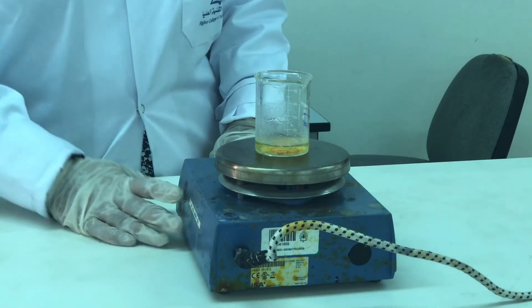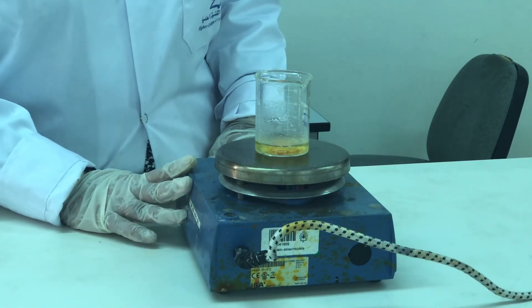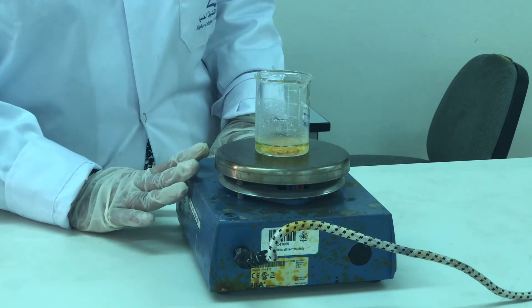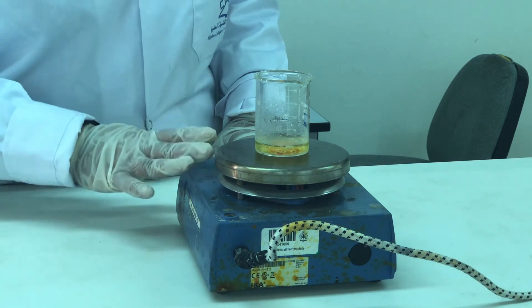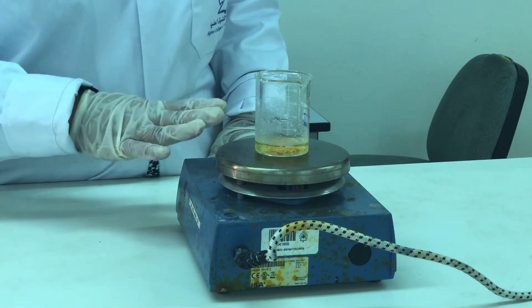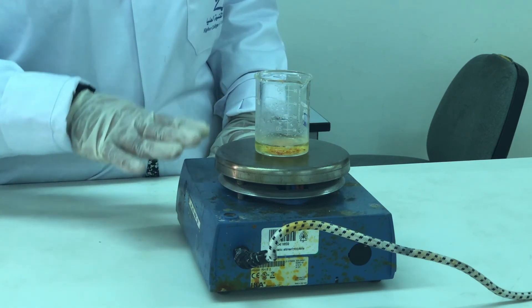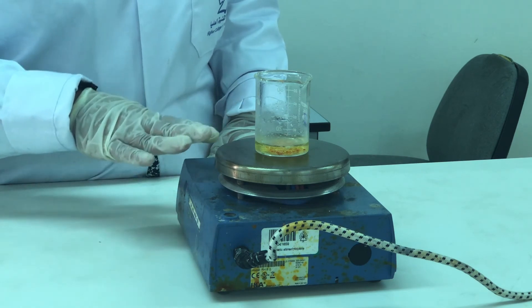Okay, this is the last step. After filtration, you get the crude product. You know what we mean by crude product? It has got a lot of impurities like excess of bromine water plus our compound and the other solvents which all will get dissolved.